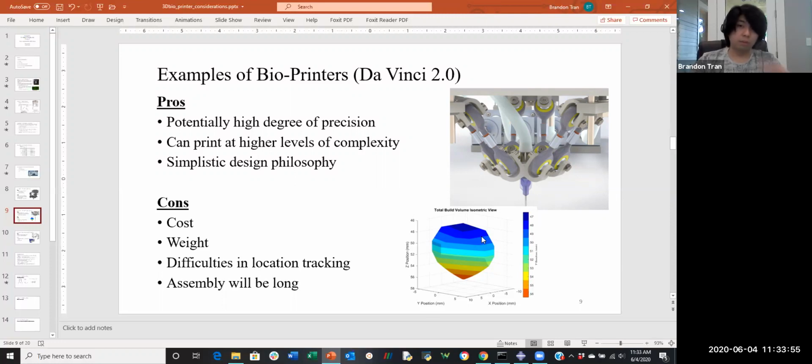It's also unique because they managed to quantify the volume that they're able to print in a designated space. Since this thing can't really translate left and right, it is subjected to a single spot, so it can only rotate. So they were able to quantify the volume they can print, and I found that a very unique way of telling the customer, this is your limitation. So there's a higher degree of precision with this kind of device, but it's much more complex. It has a higher level of complexity. You can print more complex substances with this. It's still simple in design. It's just a bunch of pistons, but cost, weight, and assembly are going to be long. Location may be difficult depending on how good you are. Now, this is completely dependent on how good you are with computer software, dynamics, and handling, so that's completely dependent on the person programming. I just put that there because a lot of people have that problem.